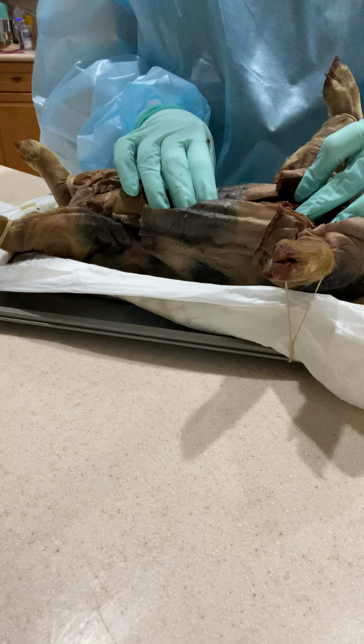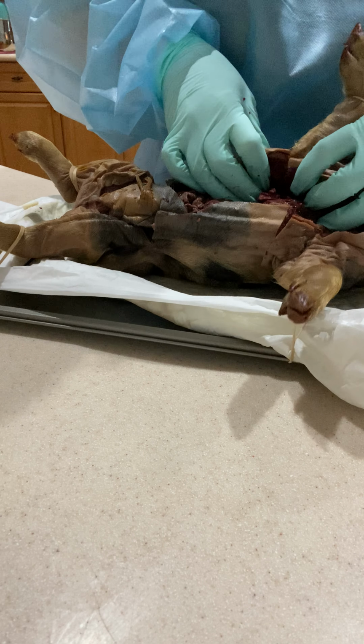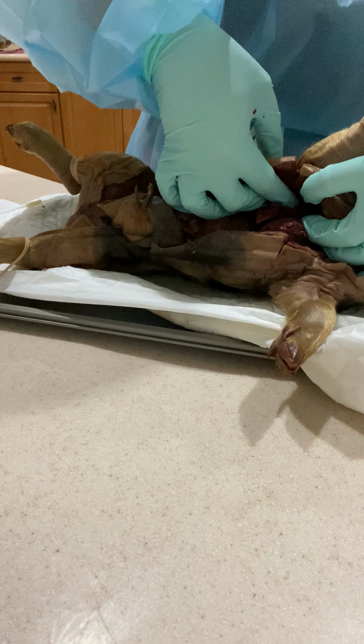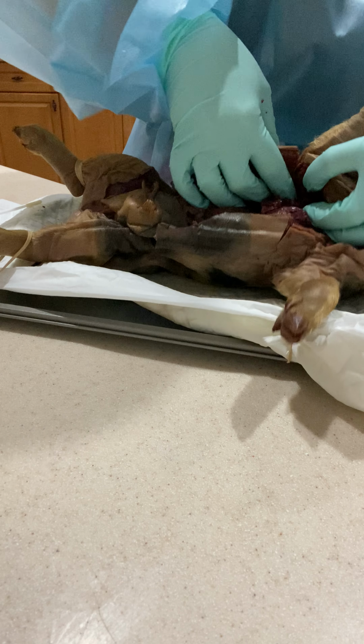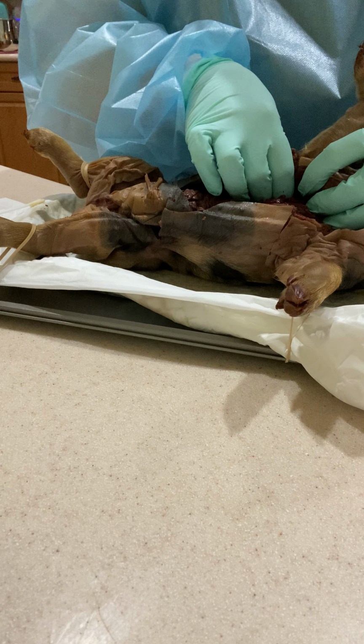And then your hilus, which I was saying earlier, creates the attachments for the lungs. I don't know if you can see, but they're back right here. So that's your little attachments right there.